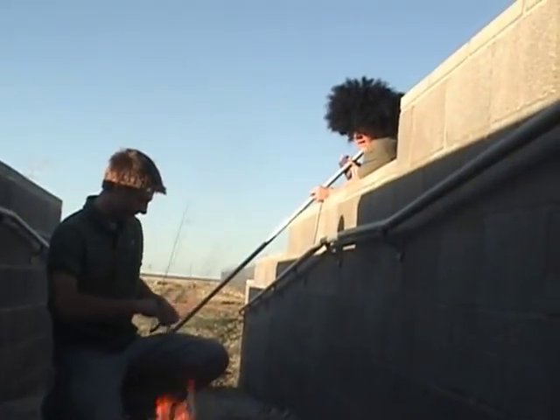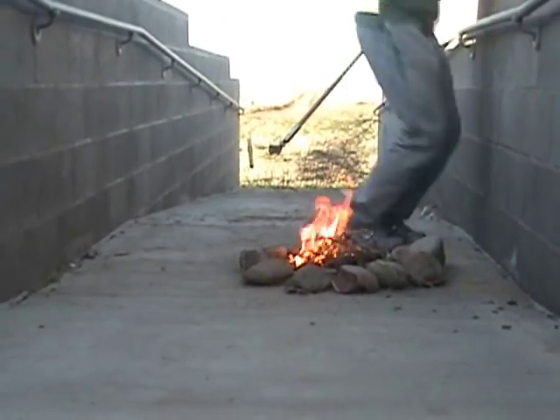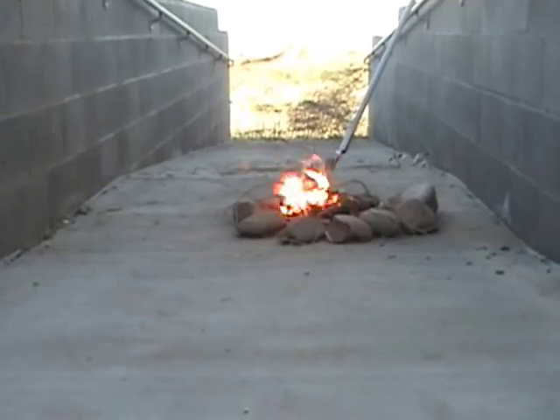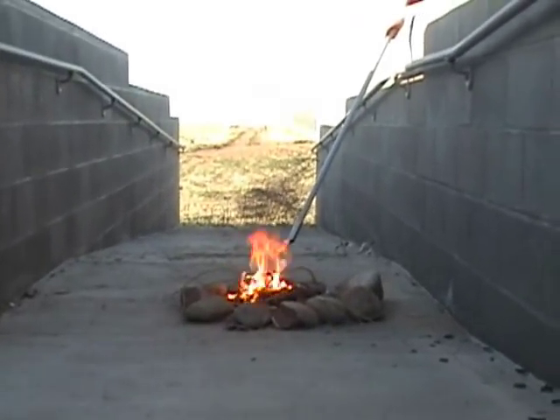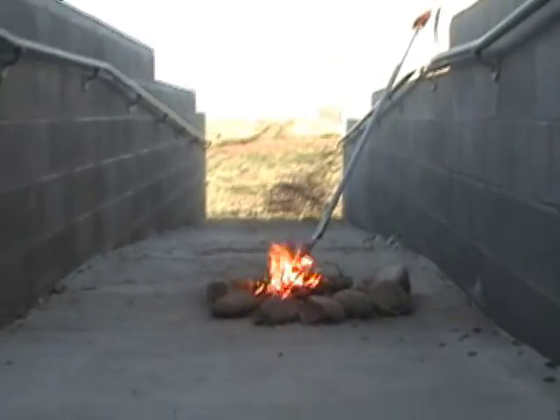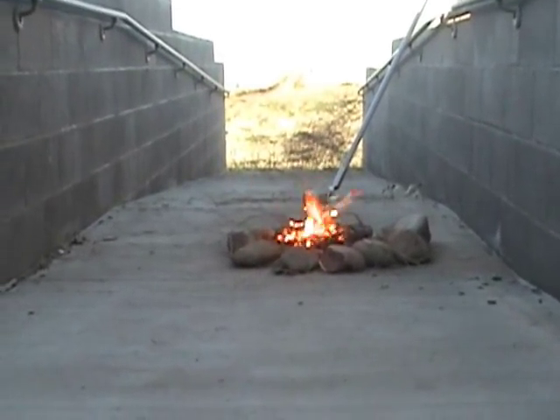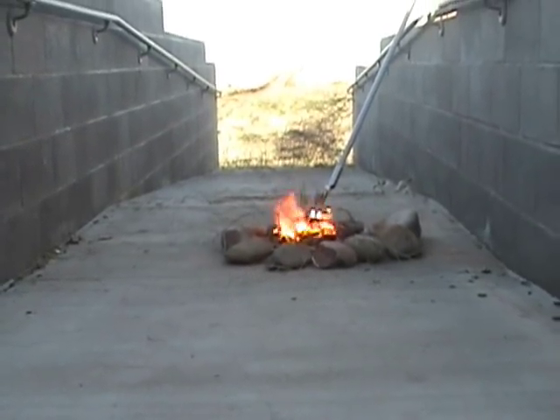Move to safety, Miles. We are good. We are going to try again — try to heat it up. There we go. Just like toasting marshmallows on a campfire, but it does not explode like this. Hopefully, we should get a good reaction soon.